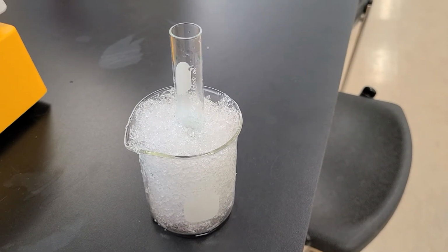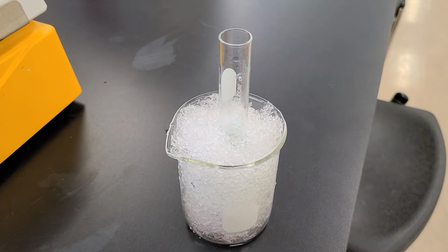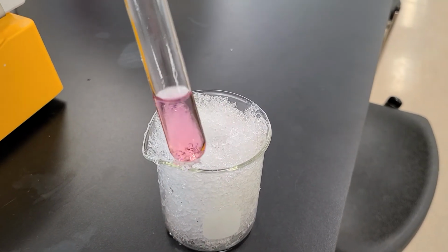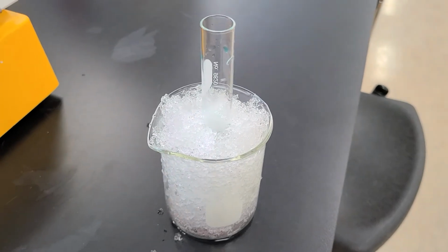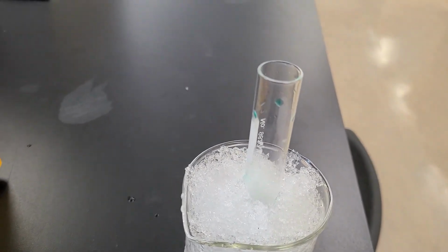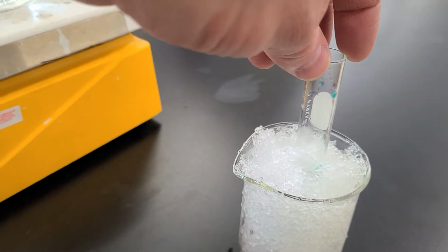Looks like it might be changing. So it was purple. So what color is it changing into? Look at that, look at that. It's kind of losing that purple tinge, and you can see what color it's turning into. I have some blue up here for some reason, I'm not sure why.